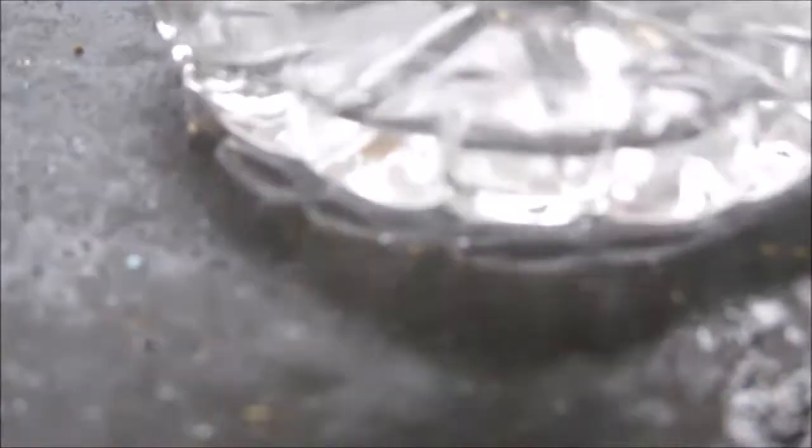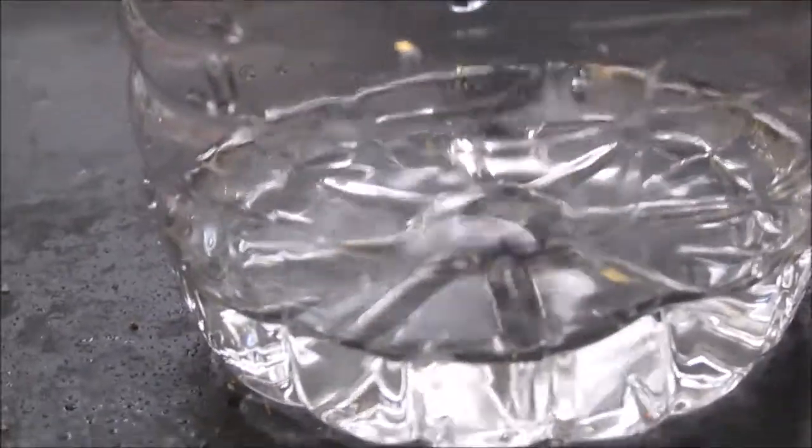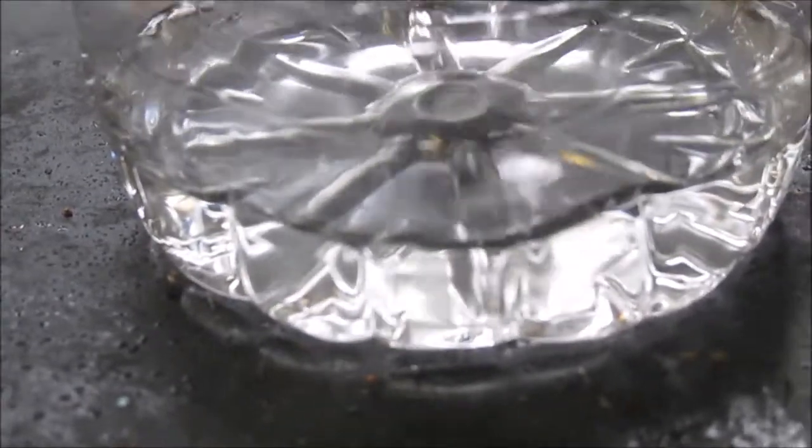So that's not just water there. That's probably slightly hydroxide. I am going to recover the sodium hydroxide, but I'm not going to put it back in the same container because it's a different concentration right now. I'm probably just going to use it to neutralize something. Here's some of the very impure crystals that got formed by that process. You can see amongst them there are some greener tones.